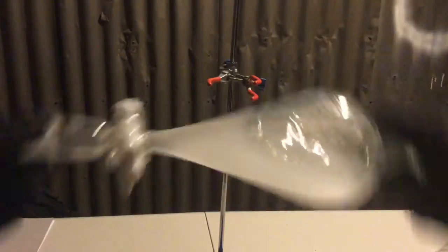The funnel was then capped, shaken and vented frequently. After this was done the funnel was placed in a clamp and the layers allowed to separate.